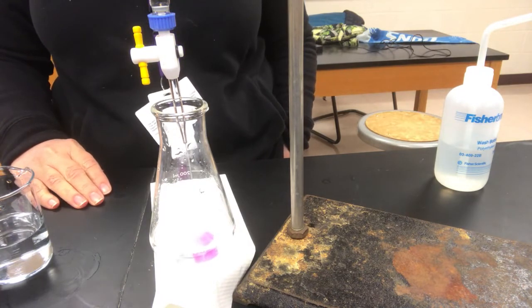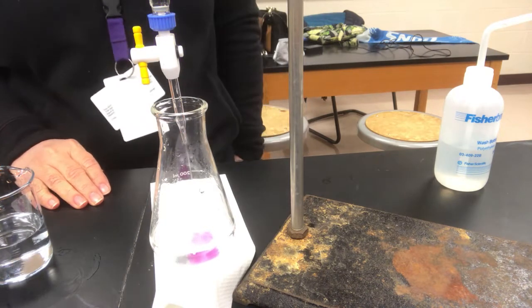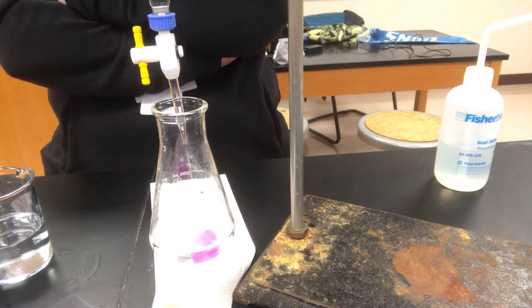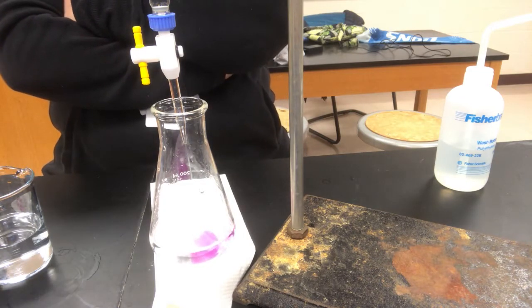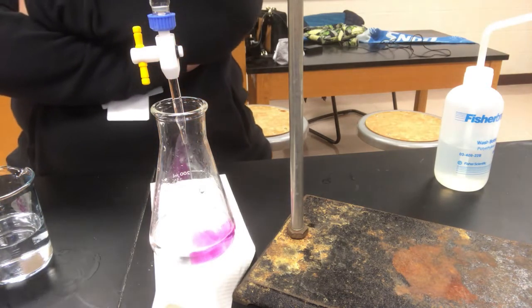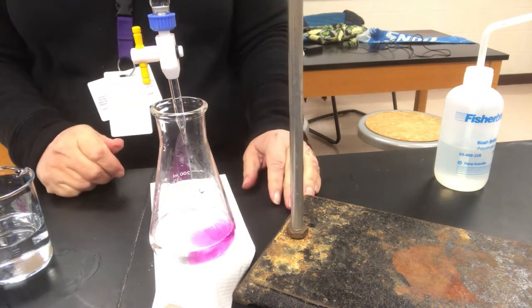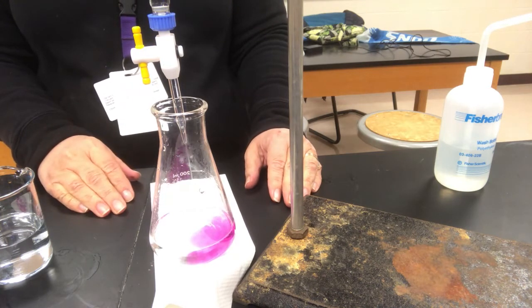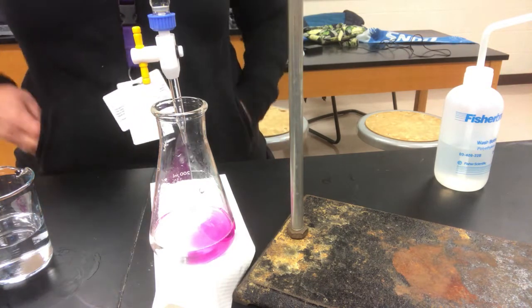And it might get a little red here, but I'm confident that when I swirl it around, that red will go away, because we will not really be at the end point yet, unless I've mixed up a solution wrong or made an error somewhere, which I hopefully have not done. If I did, I wouldn't be showing you the video. I don't think we would tape it again. Oh, seems a little slow for some reason. Have it open all the way. Patience is important. It was always my downfall in the lab as a student, just patience.